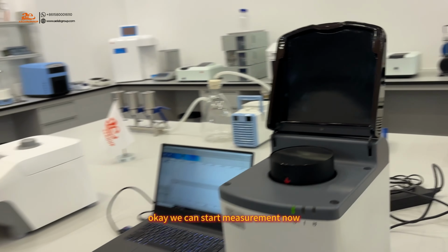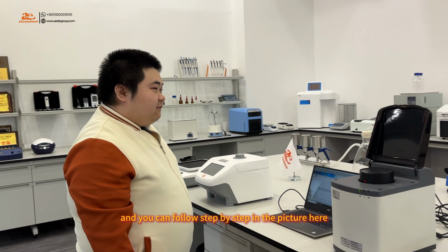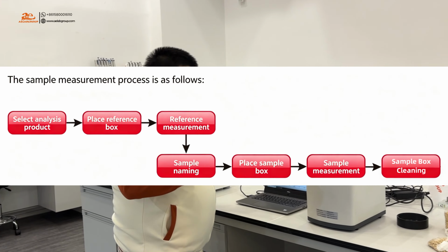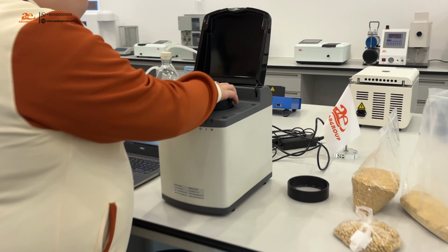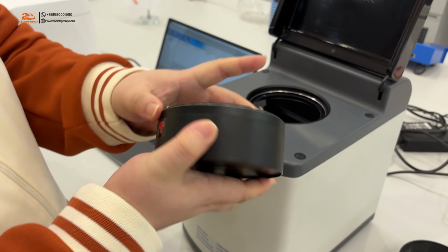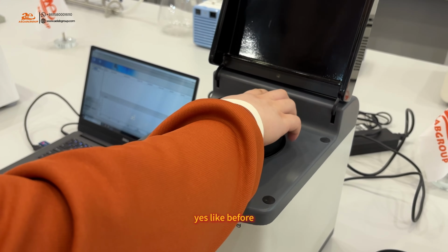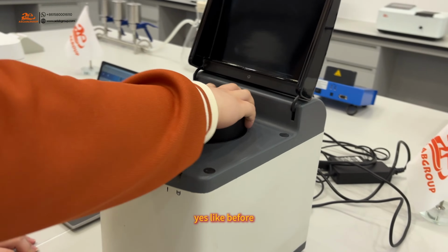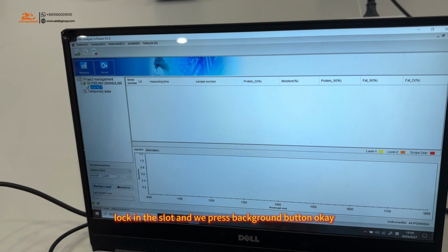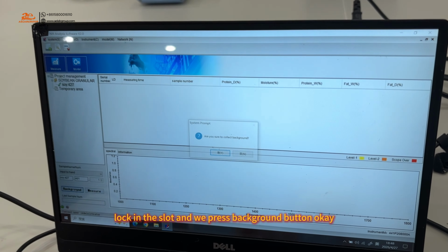Okay, we can start measuring now, and you can follow the steps shown in the picture here. Okay, we need to do background first. You can see, yes, like before. Lock in slot, and we press the background button.